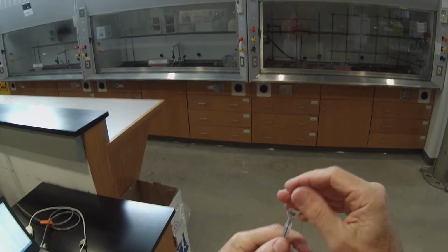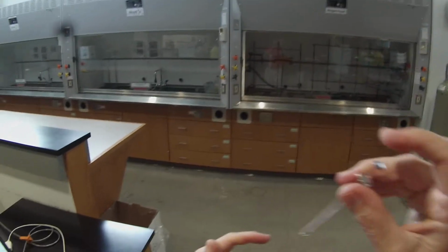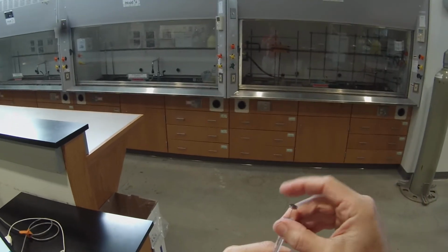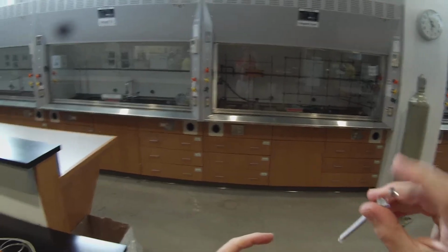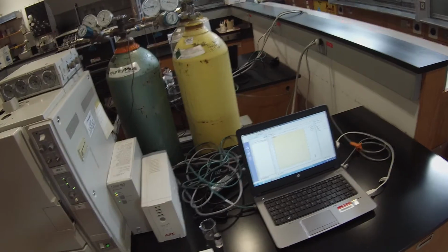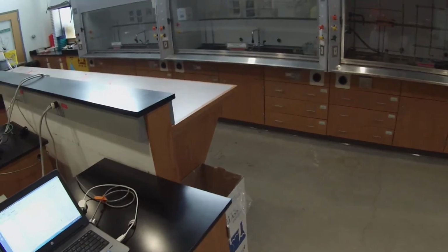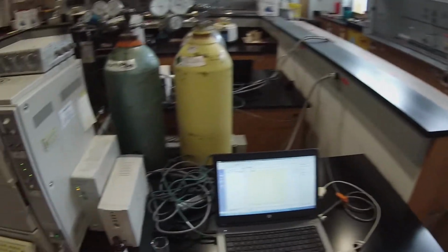by pulling up some n-hexane just to make sure that there's no residual n-butyl halides in the syringe. Yeah, 4 or 5 times. Usually pretty good. If all goes well, I won't have to inject that again. I'm just going to kind of wipe that off, clean that a little bit. So we have a nice freely moving syringe.